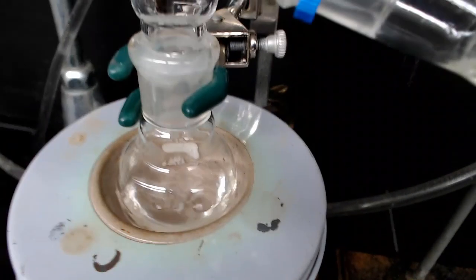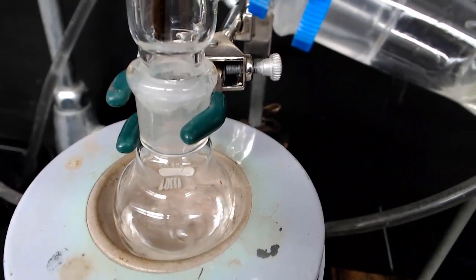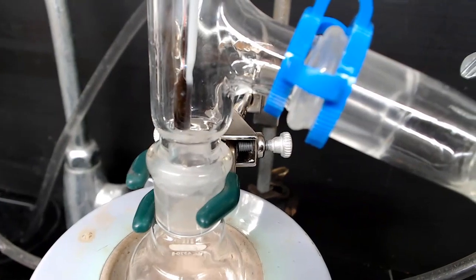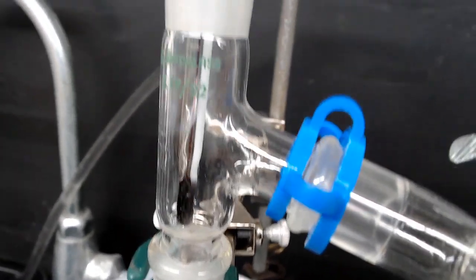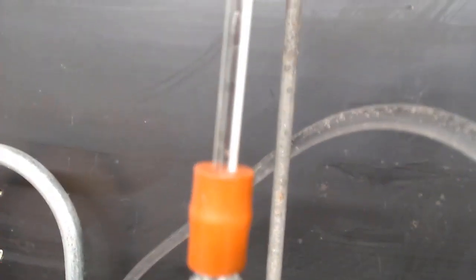We're going to zoom in here for a close-up where you can see the liquid boiling in the distilling flask, and as we pan up, you can see the thermometer bulb there. As we go higher, we're going to go up past the thermometer adapter and take a look at the temperature of the boiling liquid. You can see here it's at about 48-49 degrees Celsius, which is the boiling point of tert-butyl chloride.